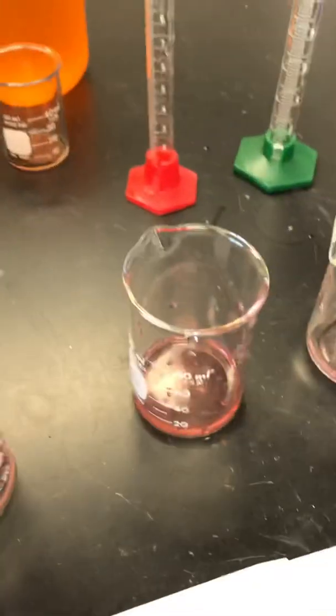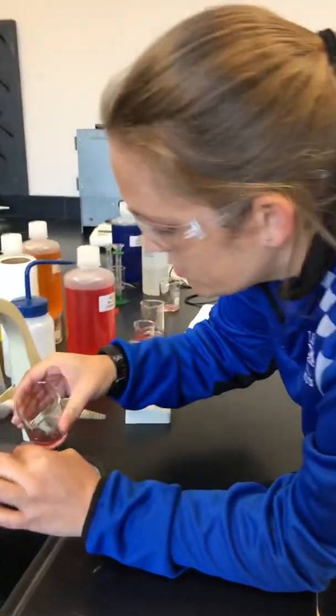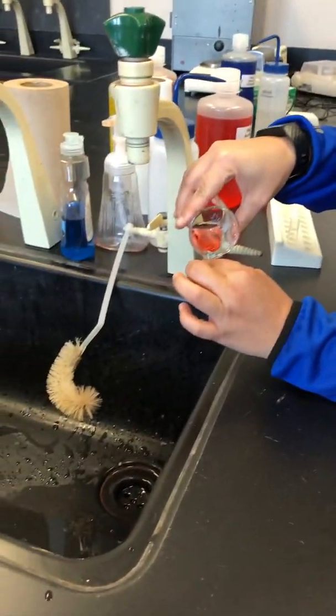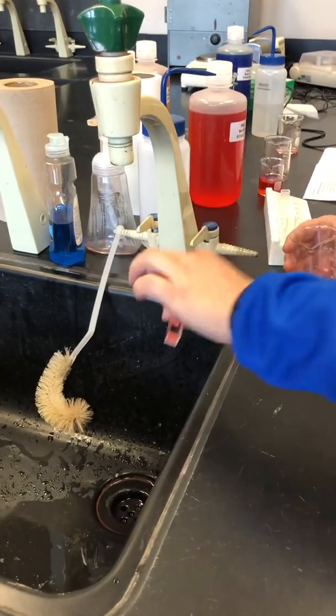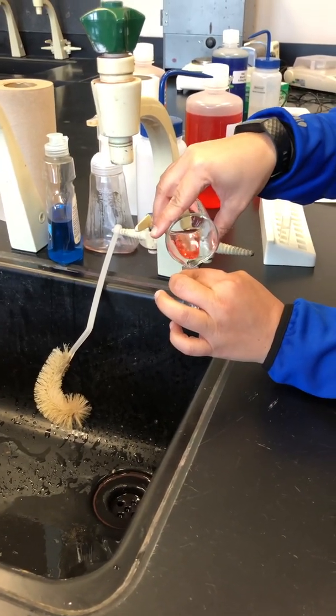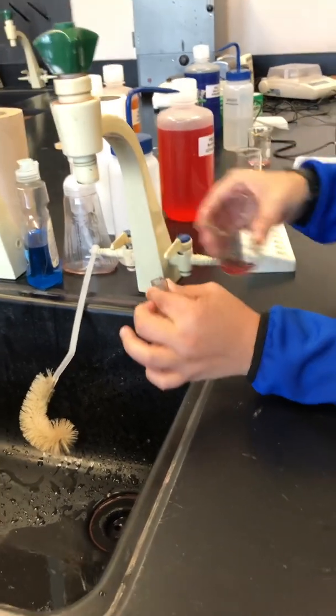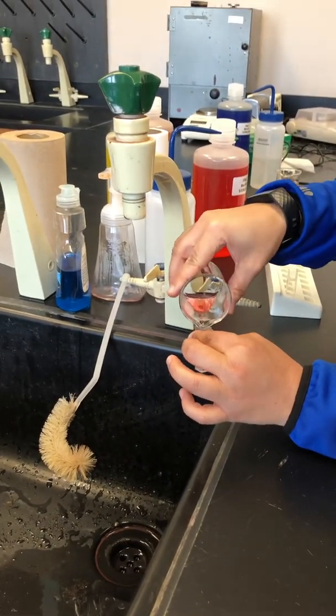So now, same process. We're gonna get real tired of seeing our dumping and pouring, dumping and pouring. You get to see where the pros are, pouring into little things and dumping them out. Part of chemistry is to do things multiple times. That's why we do so many trials, because you want to make sure that you did it correctly every time.